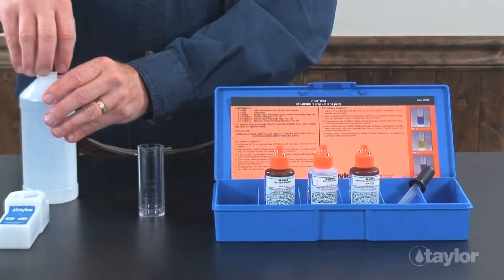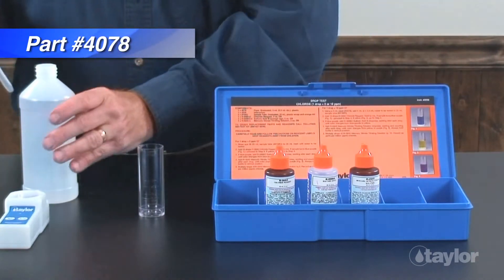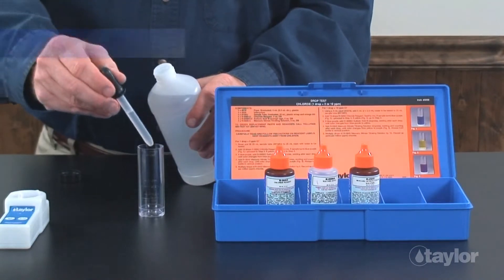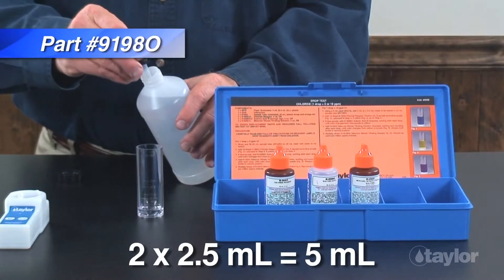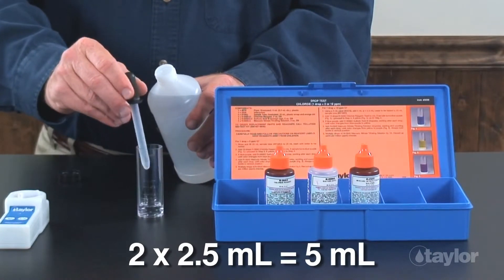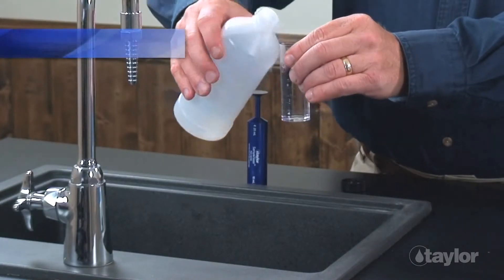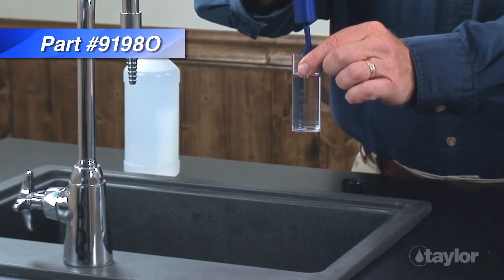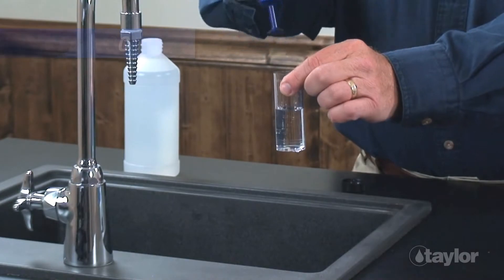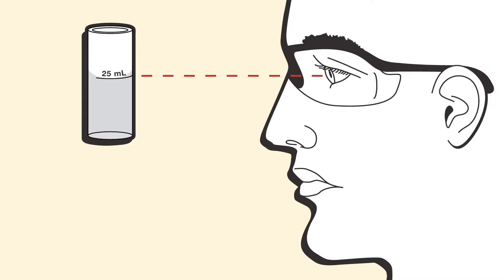First, decide which drop equivalents to use. If you suspect the chloride level is high, fill the 3 ml pipette, part number 4078, to the 2.5 ml mark with the sample water to be tested, and add it to the 25 ml sample tube, part number 91980. Dispense another 2.5 ml of the sample to obtain 5 ml for testing. For low chloride levels, rinse and fill the number 91980 sample tube to the 25 ml mark with the water to be tested. Taylor's sample sizer is a great tool for getting accurate measurements every time.